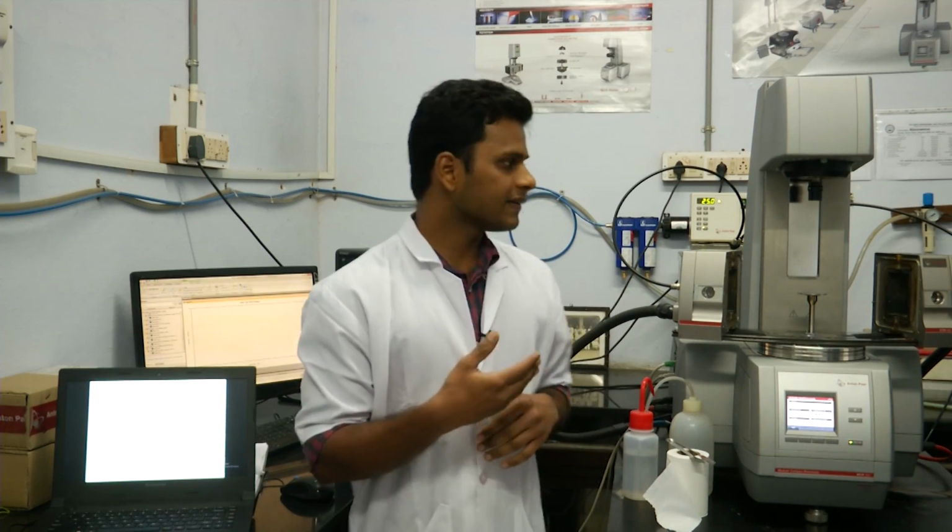For example, a rod climbing fluid, a non-Newtonian fluid which climbs the rod which is used to shear it, overcomes the centrifugal force that is exerted on the fluid, and therefore the normal stress that is developed in the RR direction is very high in magnitude. So normal stress that is exerted in the case of a non-Newtonian fluid is not negligible. Therefore, it is important to also look at the normal stress data of a fluid when it is subjected to simple shear. So how does a rheometer measure the normal stress?